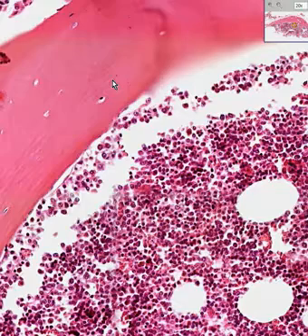This is spongy bone, and these spicules are separated from other spicules by either fatty marrow or hematopoietic marrow. And as you can see here, these cells are not fat, even though there are a few fat cells, so this is hematopoietic marrow, and I thank you very much.